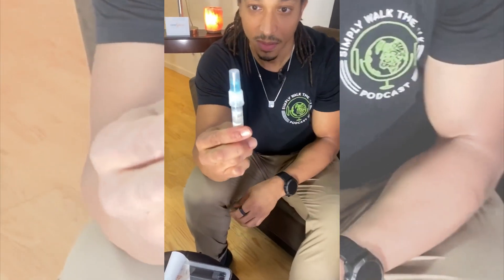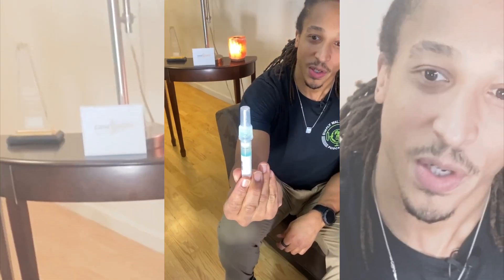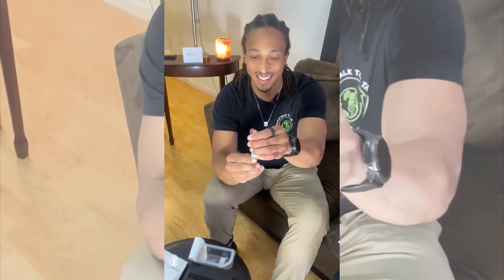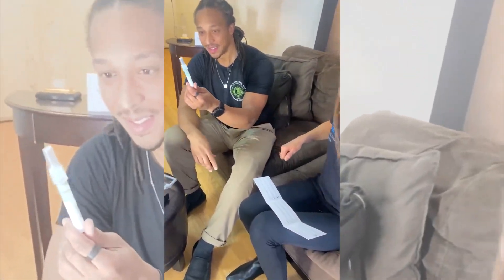See it going in there? It is going in there. There we go. Oh, that's cool! So the blue is in. You've got to shake it. Shake it up. For how long? Five seconds. Ready? Five, four, three, two, one. Okay, cool. So we've got my yummy spit with some blue stuff. And now we put this back.